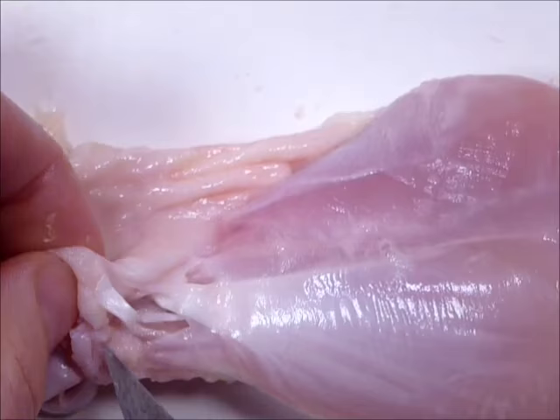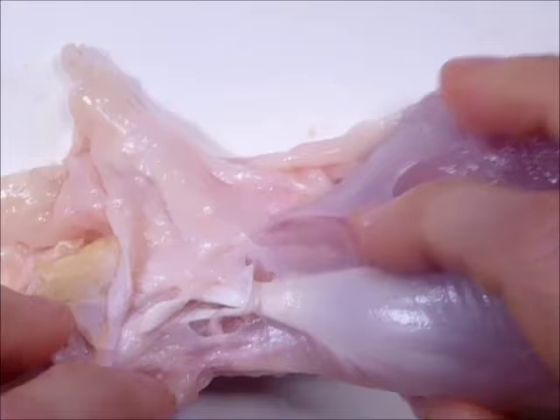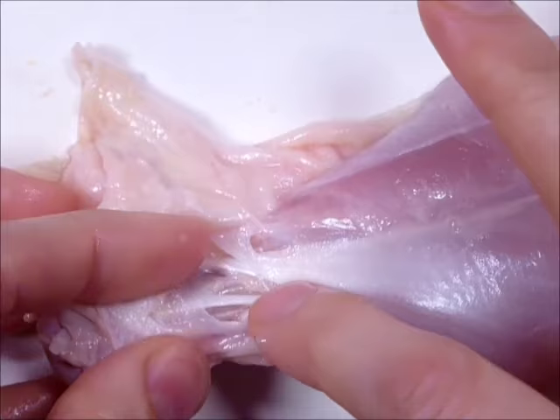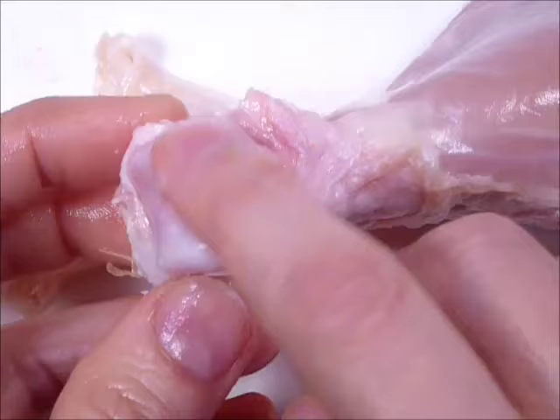Exposing the joint — I see a bunch of tendons in there. And here's another one right here. This is hyaline cartilage — those shiny white ends there. That's hyaline.